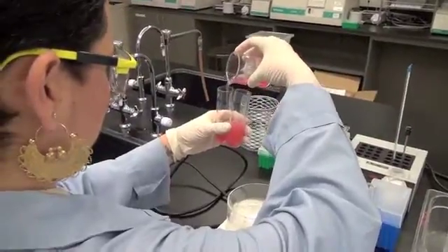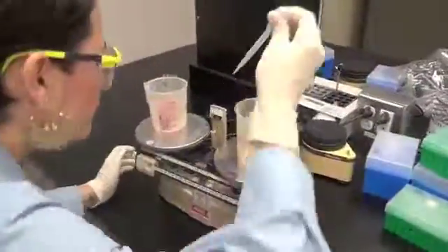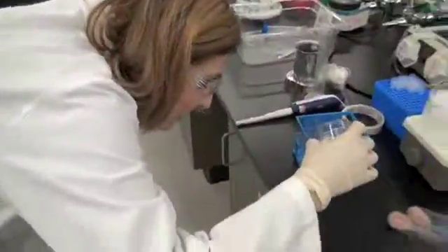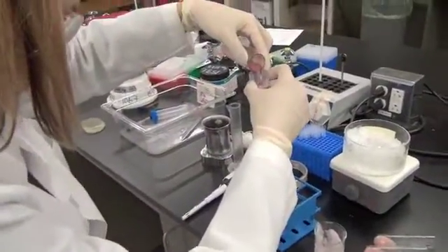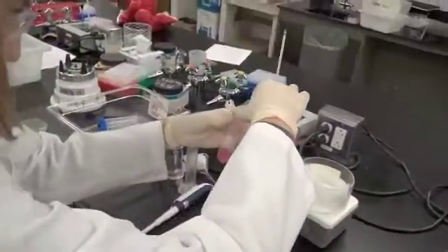Well, it looks like Biochemist Dicer is ready to spin her 40% saturated sample, while Challenger Kurate appears to not have a good control of the situation. And she just poured her sample too quickly, losing her stir bar into her 40% sample tube. She will have some additional loss of sample with that transfer.